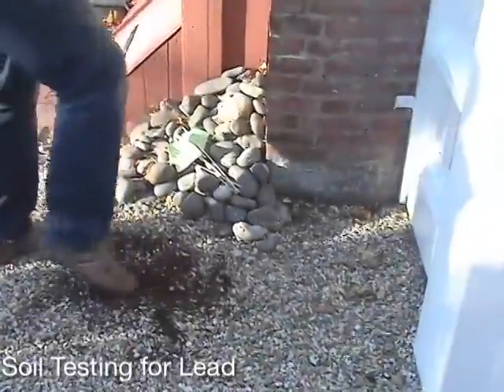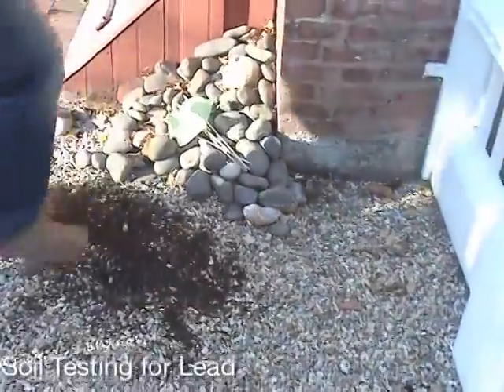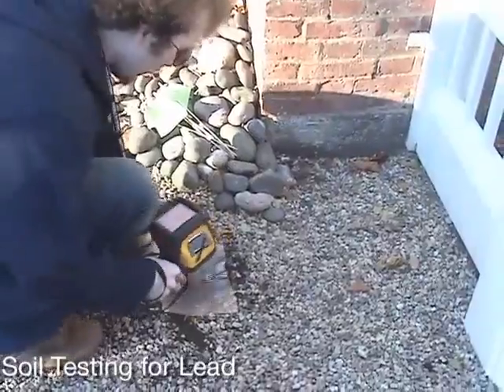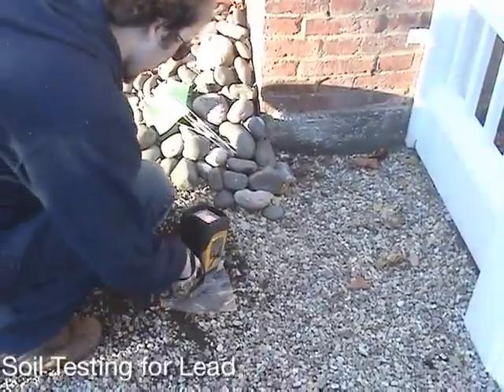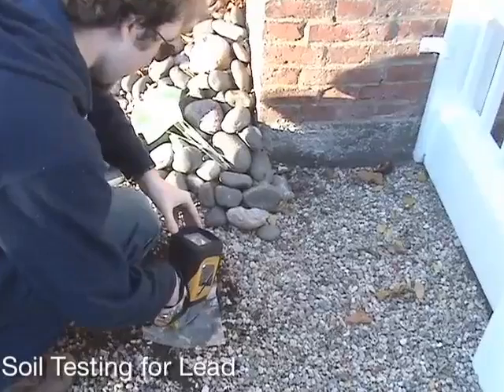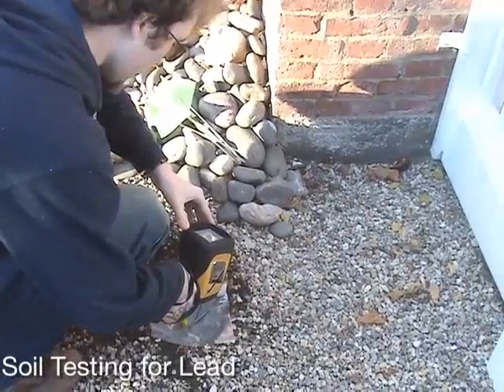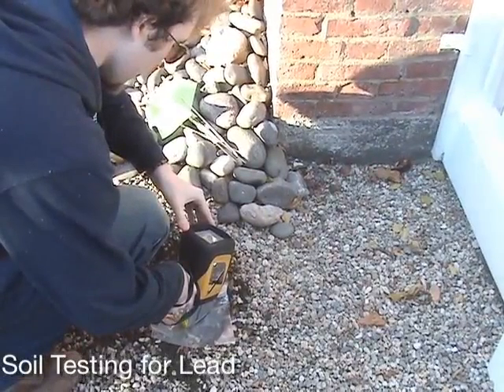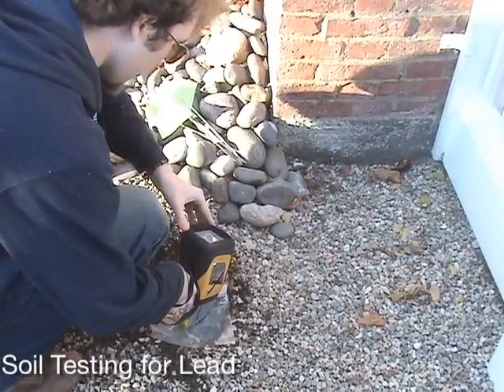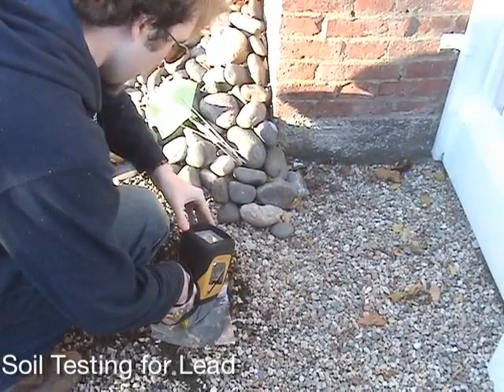The stone cover the owners placed at the drip line is being cleared to get a good measurement of the soil underneath. A plastic bag is placed on the soil to prevent transfer from one sample to another. The analyzer window is simply placed on top of that to test directly through the baggie.